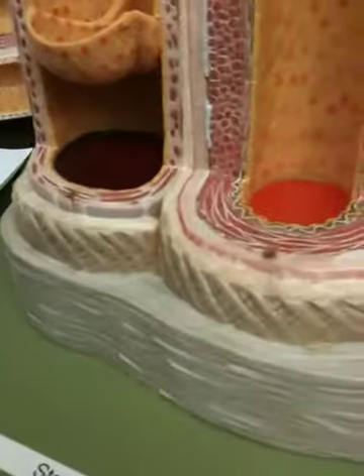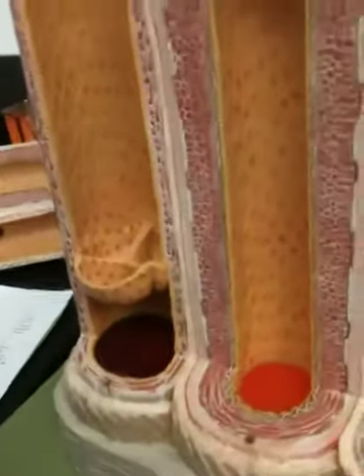So, what would this part be? Is that like an extra layer? Yeah. It is adipose tissue? That is something I don't know. I have no idea. Those are elastic fibers, I know that, but I do not know this part. Okay, let's see. Is there a key for 31? 31D. Nothing there. All right.